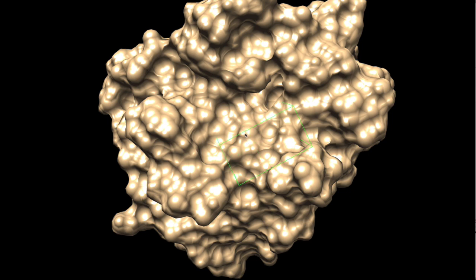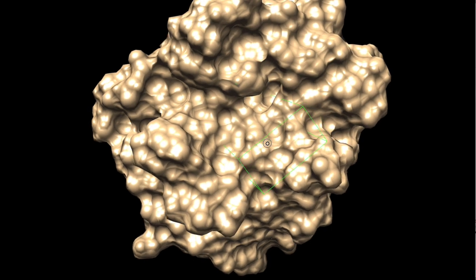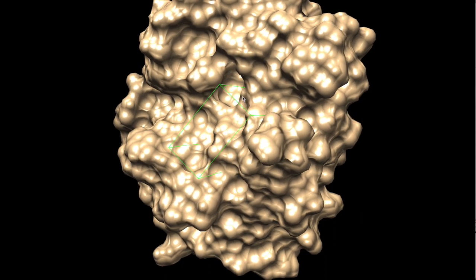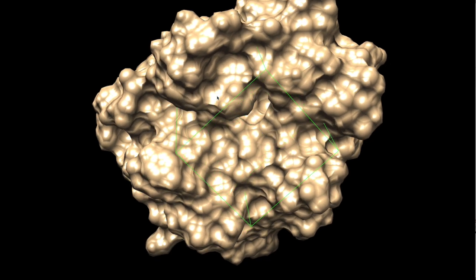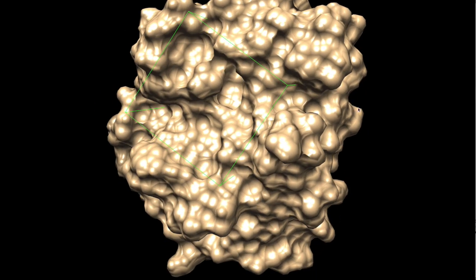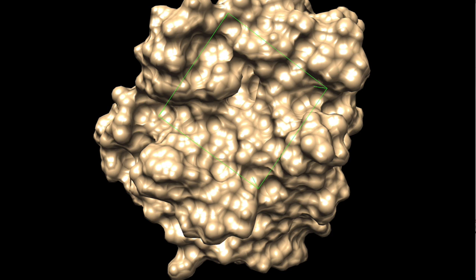All right, so you see, with these lines, I'm selecting the active site where the docking will take place. Now, to resize the box, it's best to move it around and click on a particular face of this box, and you can extend it using the same pair of buttons. In my case, this is Control and middle click. I will Control middle click on this face and extend it. The bigger the box, the longer the simulation needs to run. I see this box is too big, so I will adjust it. I know that my active site is somewhere here. This should be fine. If I'm happy with it, I can move to the next step.